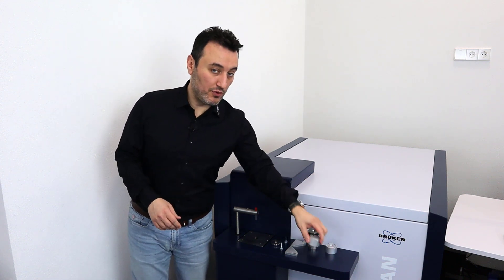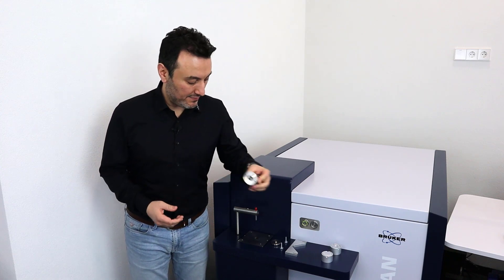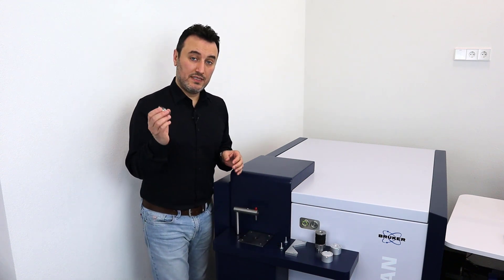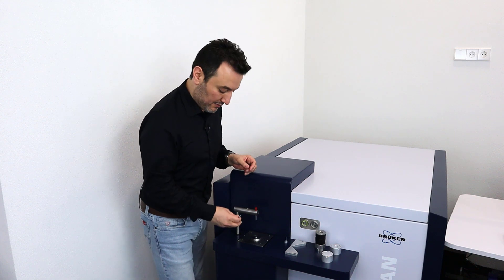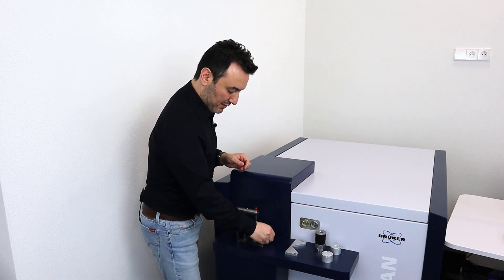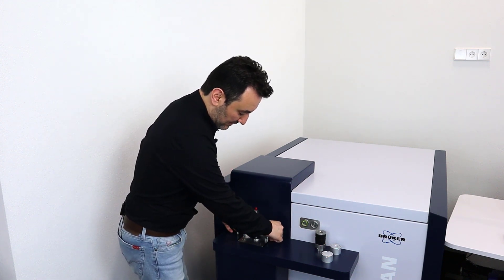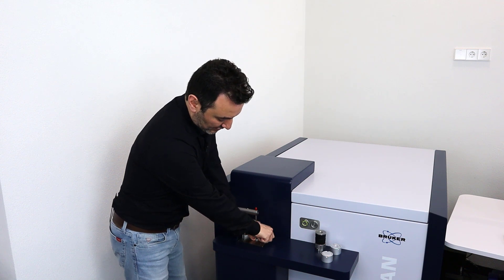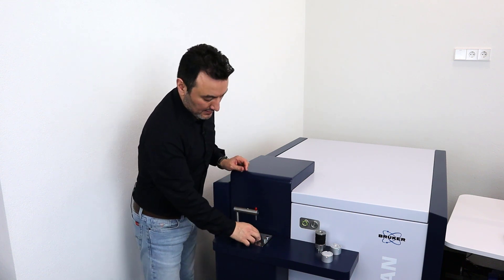The adapters such as the small sample adapter, thin wire adapter, and thick wire adapter that we have seen before. This centering device set comes with a centering disc. I put the centering disc just on top of the hole of the spark stand plate, take my screws and insert them just a little bit. Then I take my V-shape fixing device and place it just like this, and tighten the screws. Then I remove the centering disc.